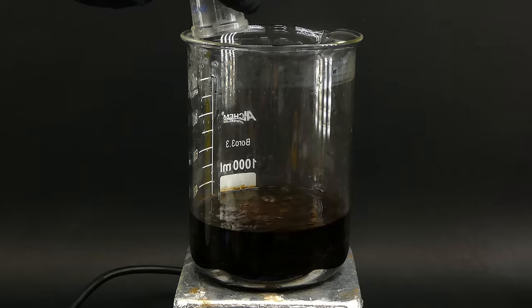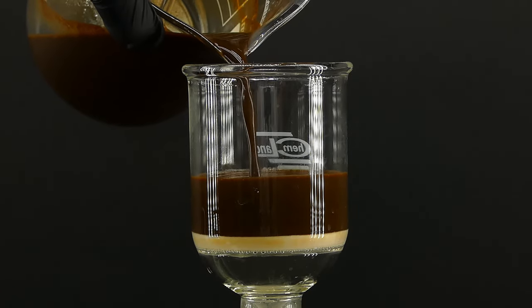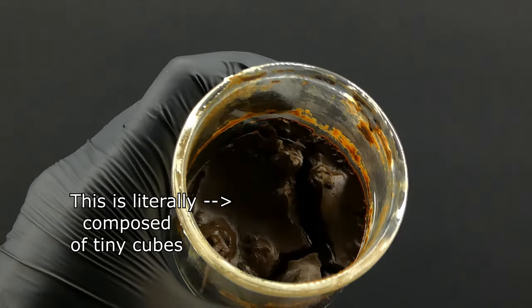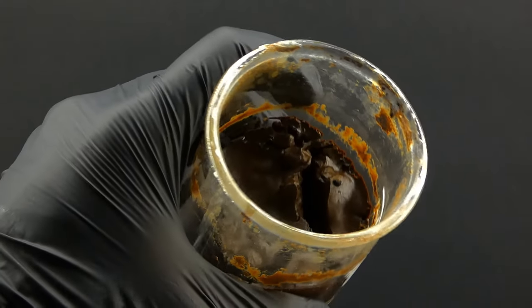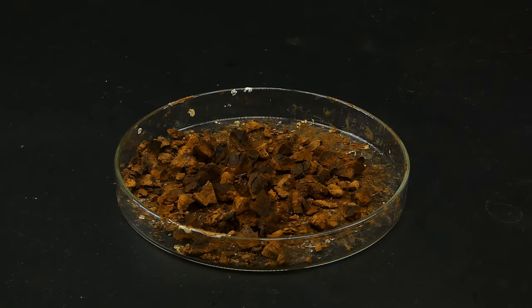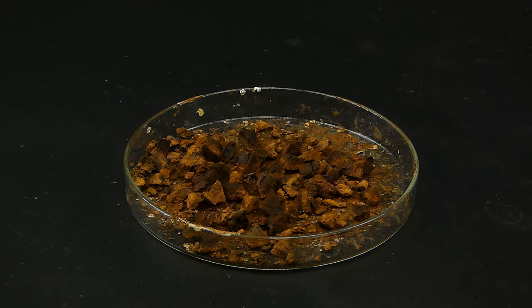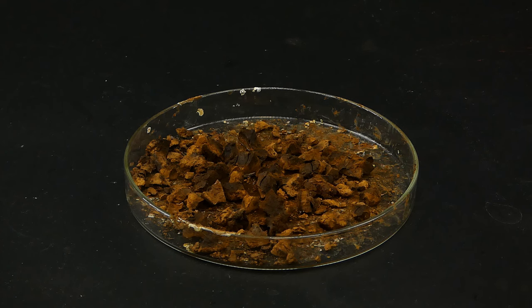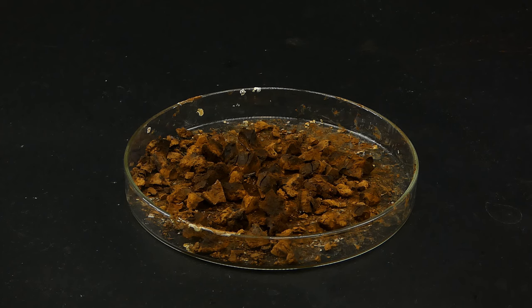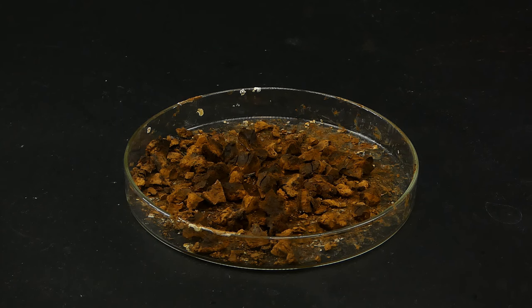I then acidified it again to precipitate out the cubane diacid and filtered it again — which took another 9 hours — leaving me with some wet and brown cubane mud. I dried it in the oven, leaving me with around 11 grams of these brown chunks that look like dirt. It's kind of funny how it took me 4 months of work to make them. I'm also pretty sure that they are actually the cubane, because it's pretty much the only thing here that could react to acids and bases like that. I could stop here, but I wanted to purify it and maybe end up with some nice crystals.